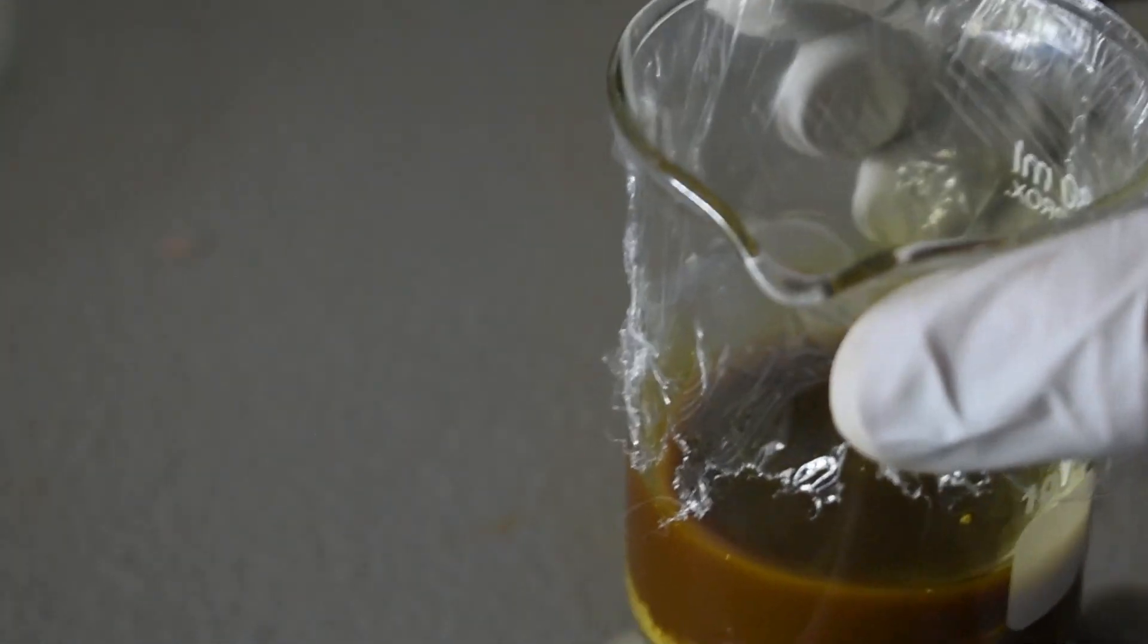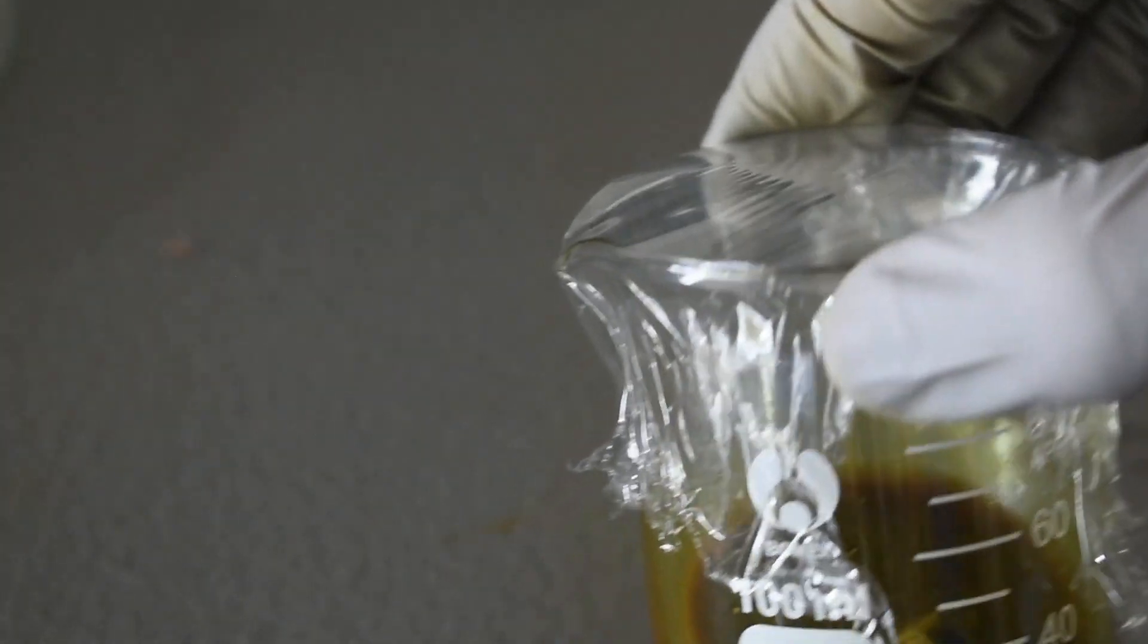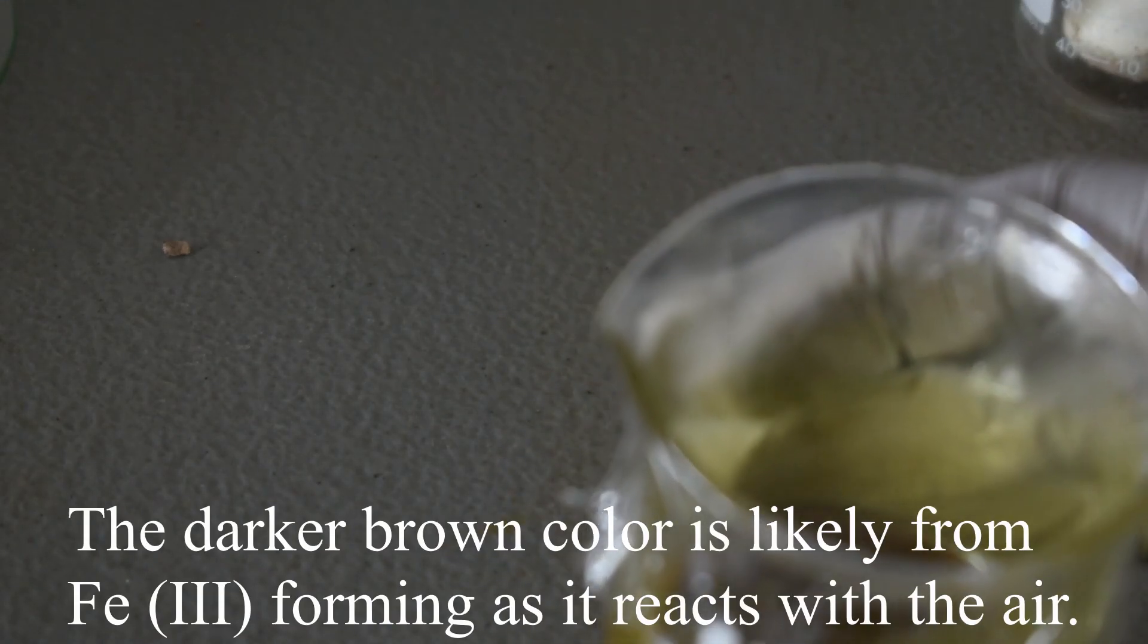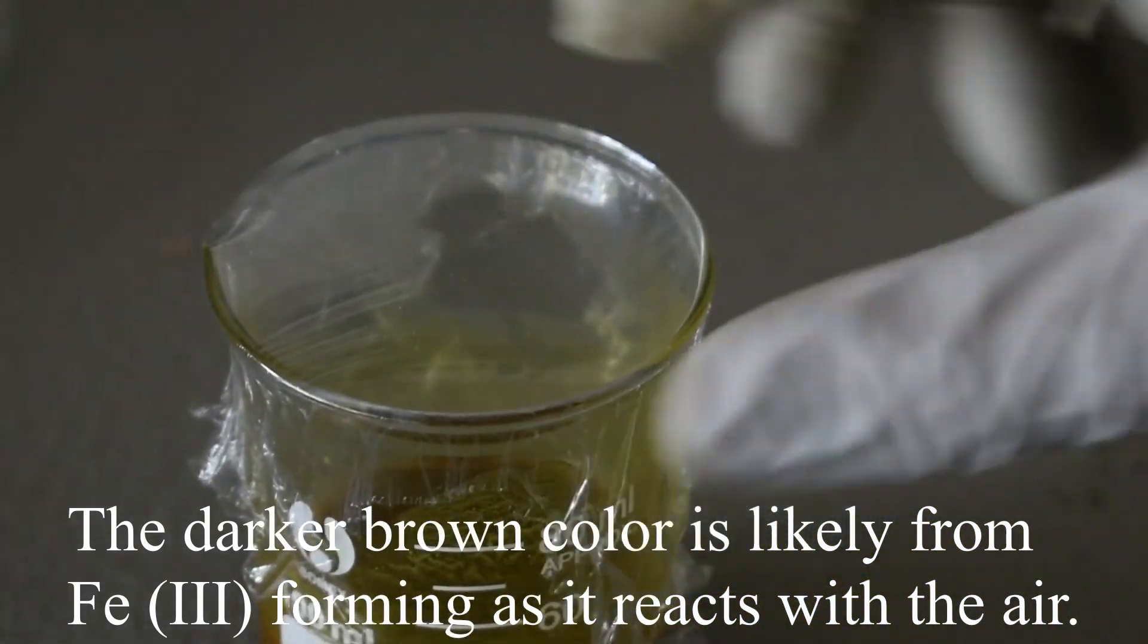It's very hot to the touch. The volume of pyridine has decreased. It becomes attached to the iron 2 chloride. And we're going to keep mixing until everything has fully reacted.